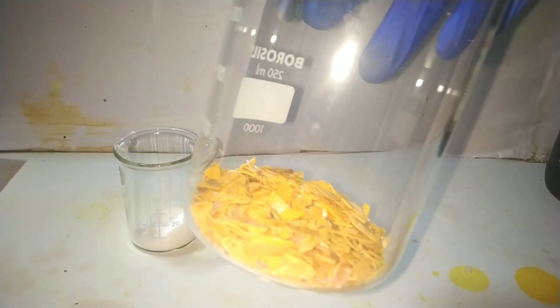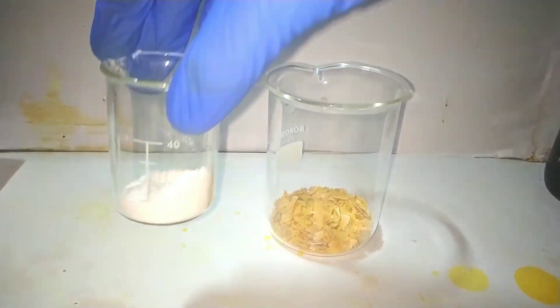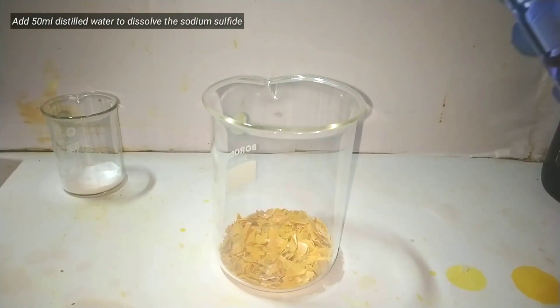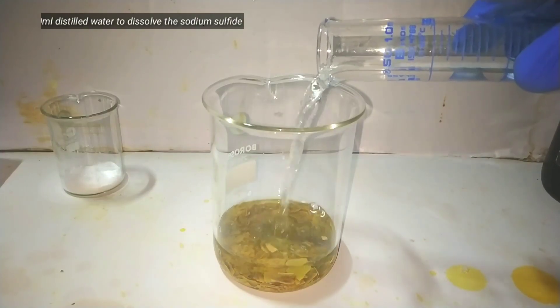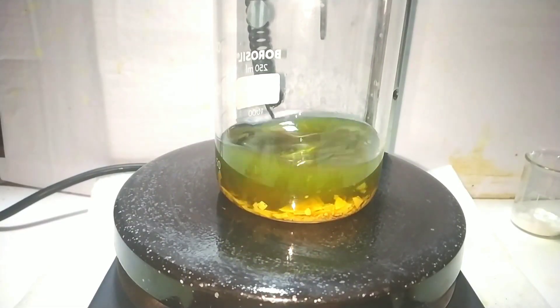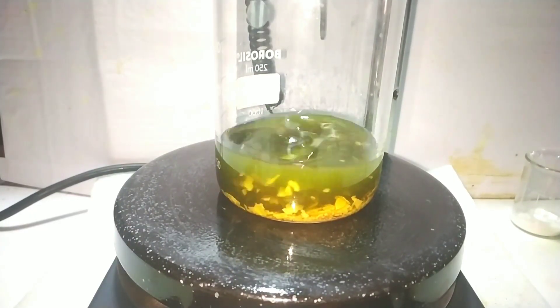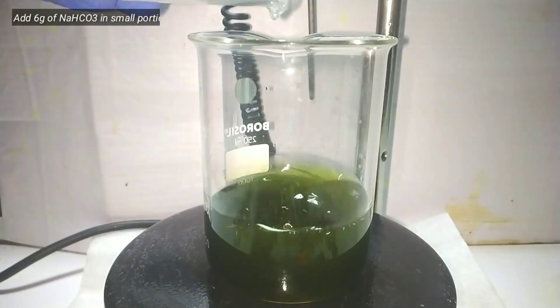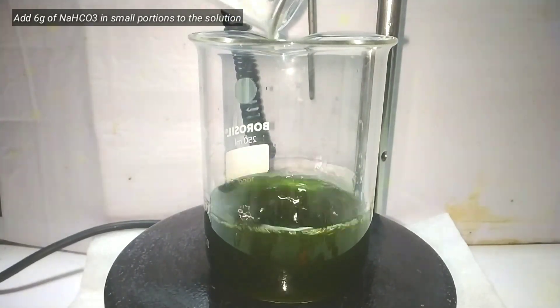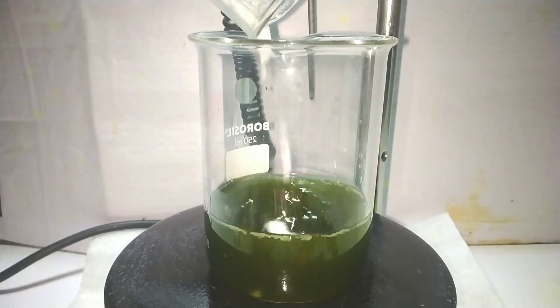The first step is to prepare the reducing agent sodium hydrogen sulphide. For that we need 18 grams of sodium sulphide and 6 grams of sodium hydrogen carbonate or sodium bicarbonate. Add 50 milliliters of distilled water to the sodium sulphide and stir vigorously to dissolve it completely. When we get a clear dark solution, add 6 grams of finely powdered sodium hydrogen carbonate in small portions with constant stirring. Allow the bicarbonate to dissolve completely.